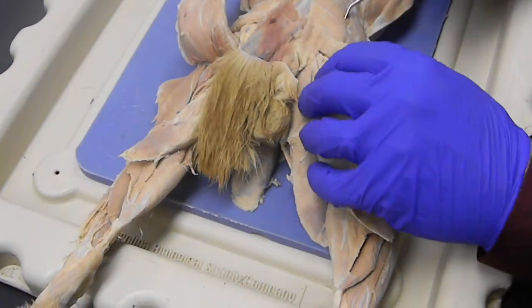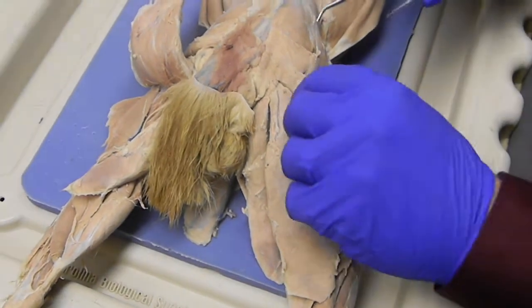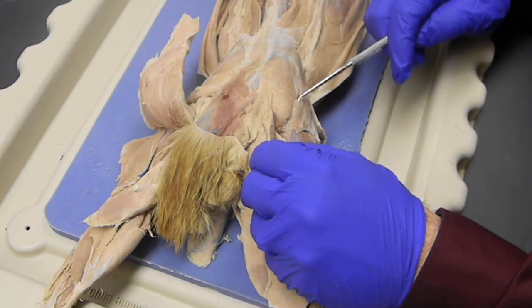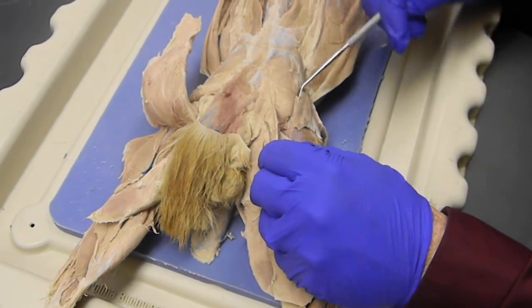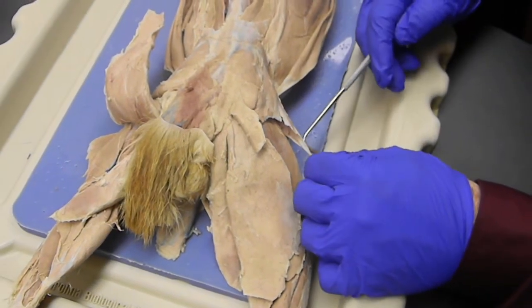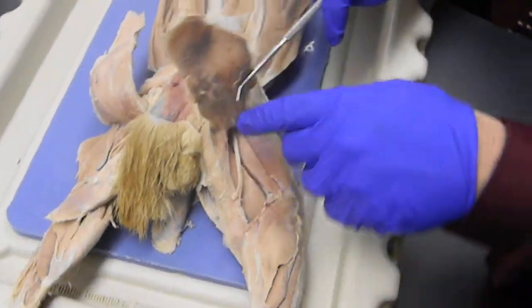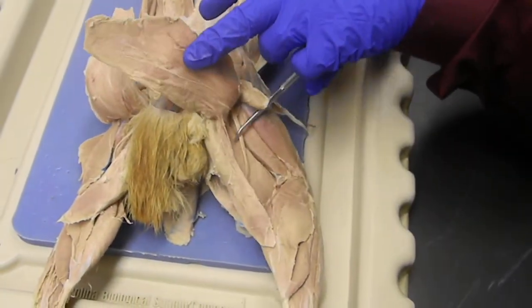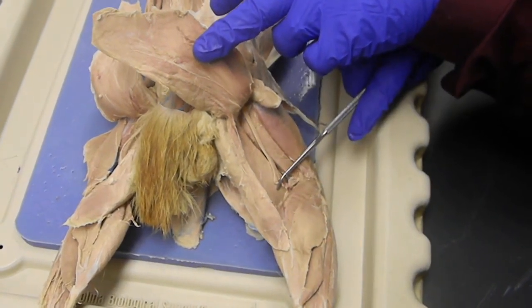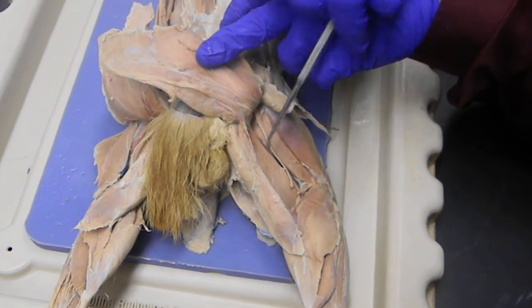On the leg, okay, these are not done. Okay. We have the biceps femoris, the caudofemoralis, the gluteus maximus right up to here. This whole big piece right there is the gluteus medius. This muscle that's kind of triangular in shape is the tensor fasciae latae. Then it goes to the fascia lata or the IT band. The nerve that's cut right here is the sciatic nerve. That's the semitendinosus, and that's the semimembranosus. And that little muscle right here is the tenuissimus. Those make up the hamstrings in the cat.